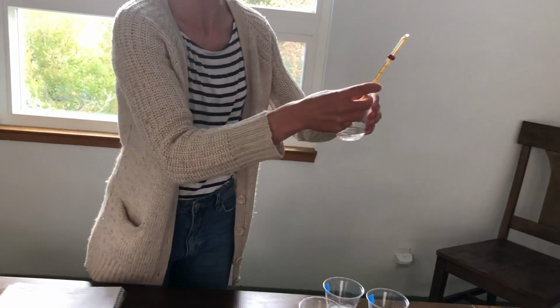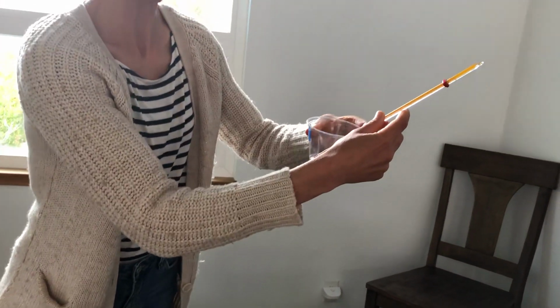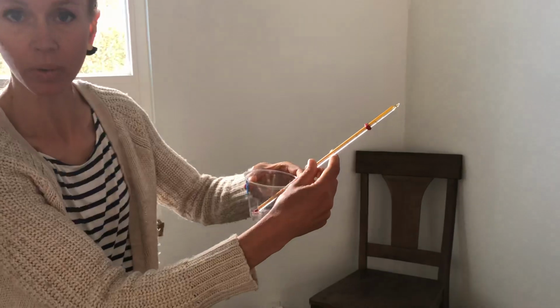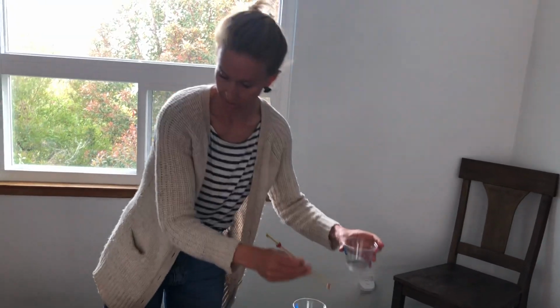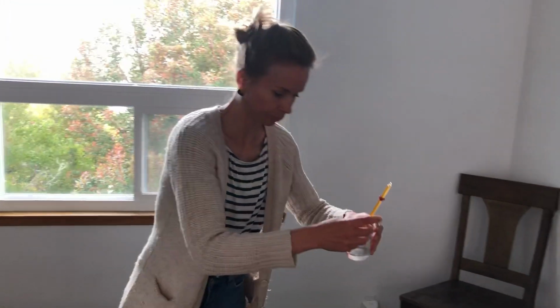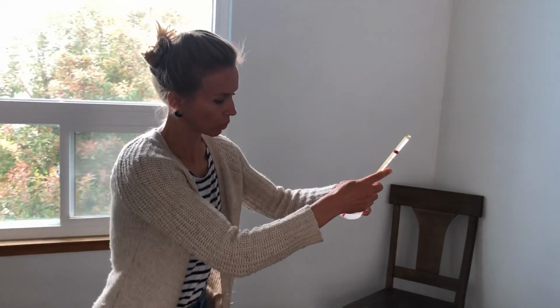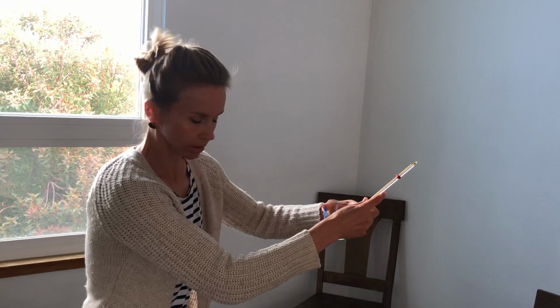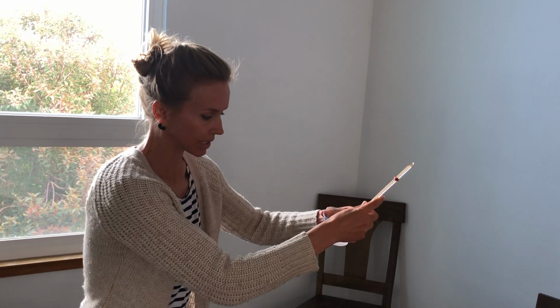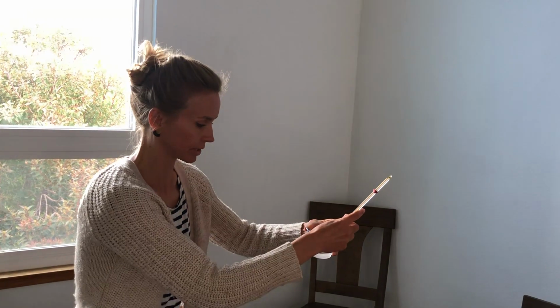But if it were to have reached freezing and then gotten to its melting point, that would have happened at negative 20 degrees Celsius, okay? Negative 20 degrees Celsius is number 3. Number 4 is also just starting to melt. It didn't quite freeze overnight, and its melting point is also 0 degrees Celsius, okay?